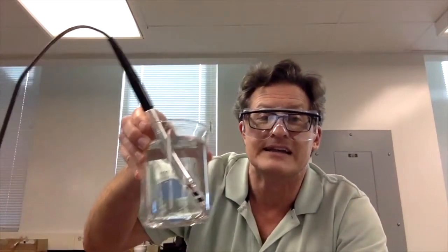And, right, the other thing that we need, that in our, we've got a bunch of solutions there, 5 different ones. We want to make sure we don't cross-contaminate. So not only are we going to clean in between each solution, but we're going to start off with the lowest concentration, right? Why are you going from the lowest concentration?